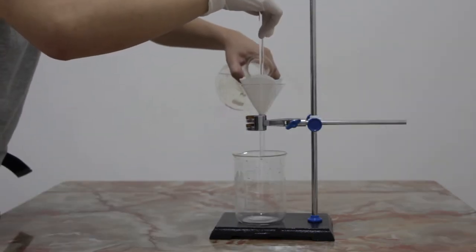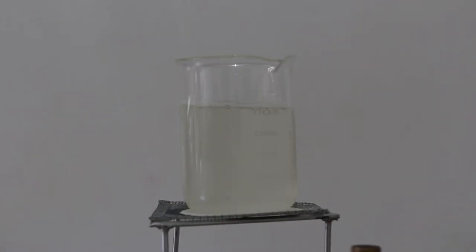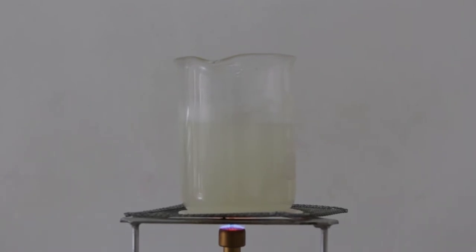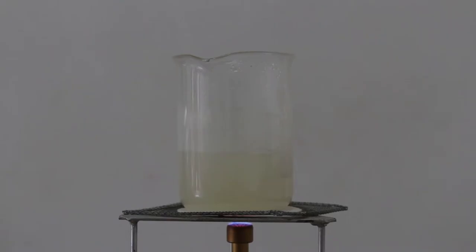The filtered solution is then filtered again through another layer of filter paper. The solution is then transferred to a beaker and heated to boil off the water. The content may get more cloudy as the water is boiled away.